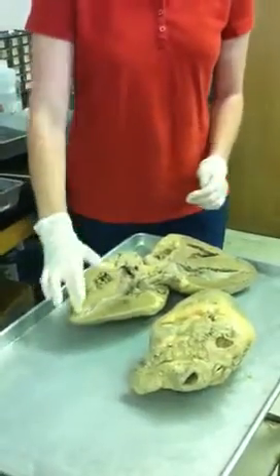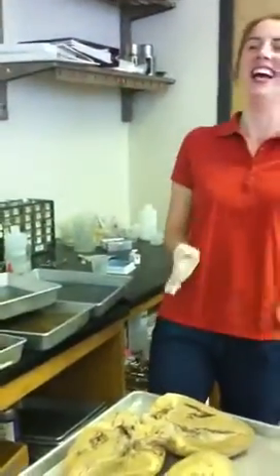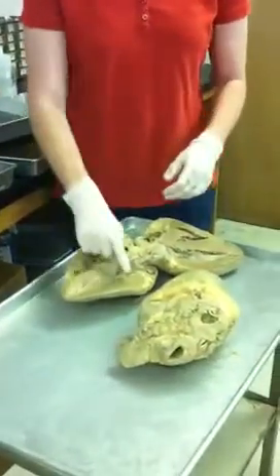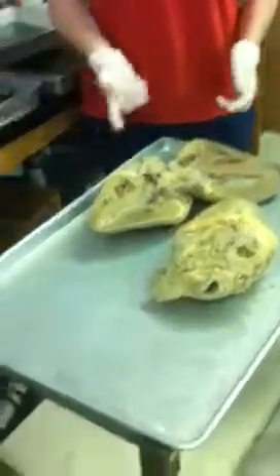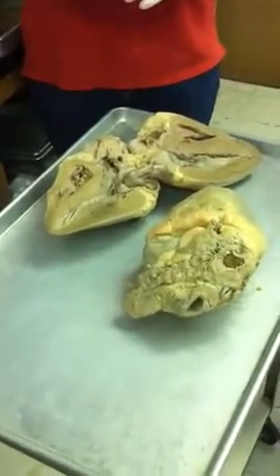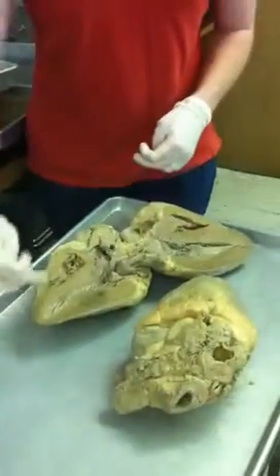What is heart muscle made of? Cardiac muscle. What's so special about cardiac muscle? It doesn't get tired. It doesn't spasm, like a Charlie horse. It's involuntary. Very good. What defining characteristics does it have? Intercalated discs. It's striated, remember, and it does branch. Very good. That's all myocardium here.